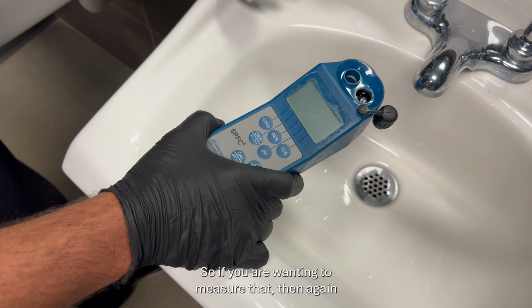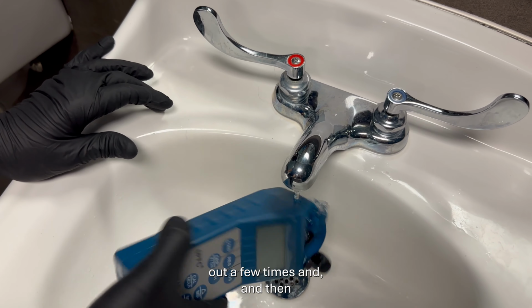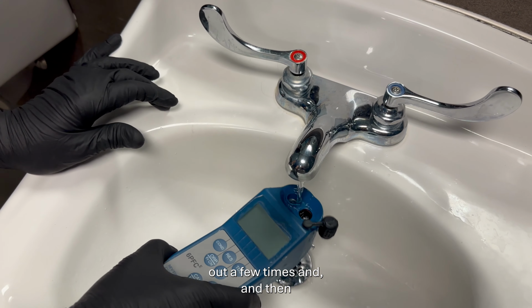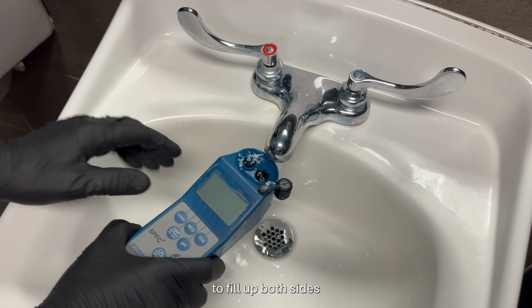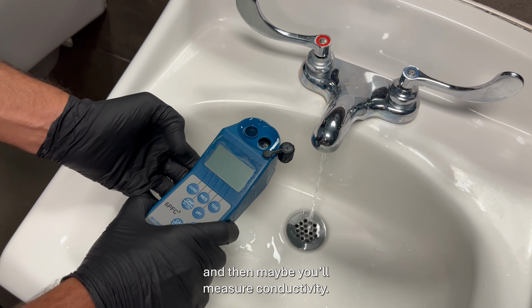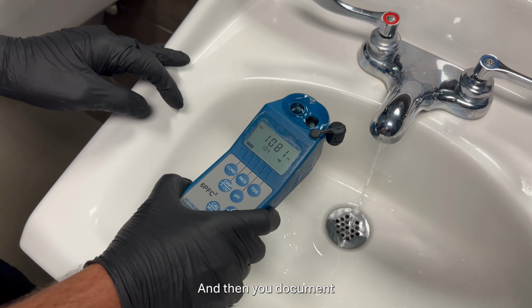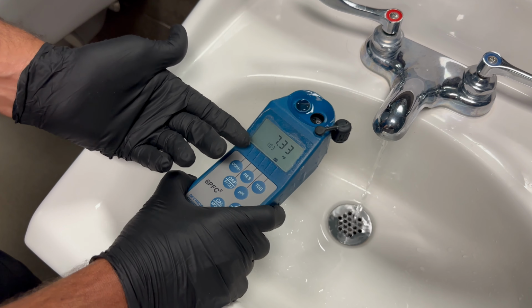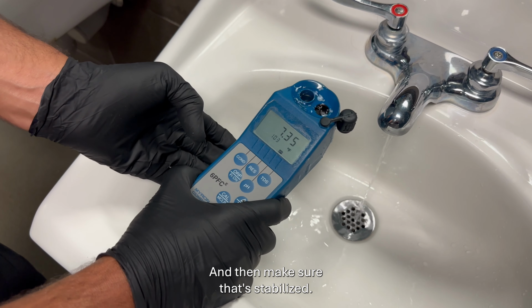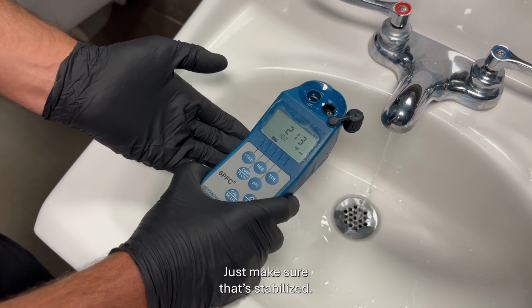If you are wanting to measure that, again, you want to turn your water on and rinse this out a few times, and then fill up both sides and measure your conductivity. You switch it for a second, and then you document what your conductivity is. Do the same thing for pH, and make sure that's stabilized. And then you can do the same thing for ORP, and just make sure that's stabilized.